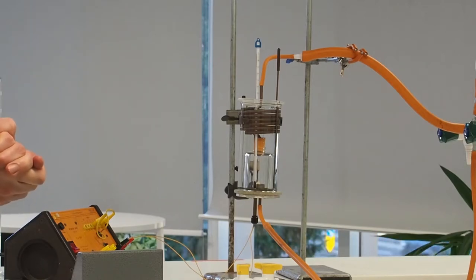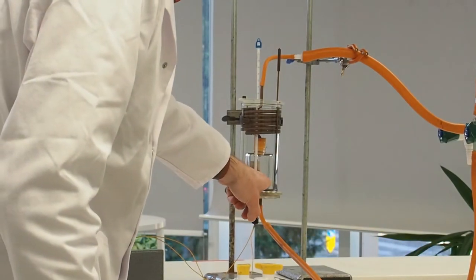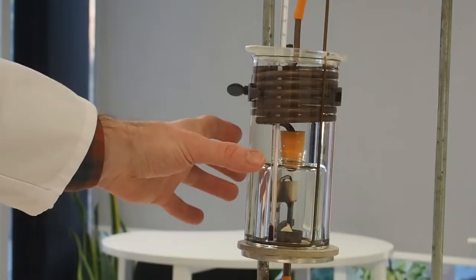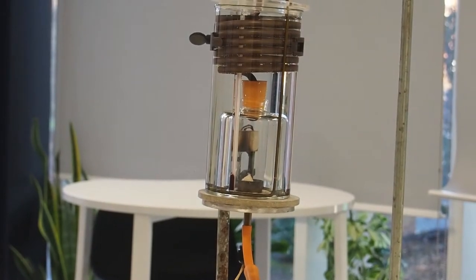The reason why this is better, hopefully you can observe it itself, but we're going to be burning a piece of food which is located in the middle of this chamber here. It's a chamber which is surrounded by a volume of water which then has a lid on it on top of that.